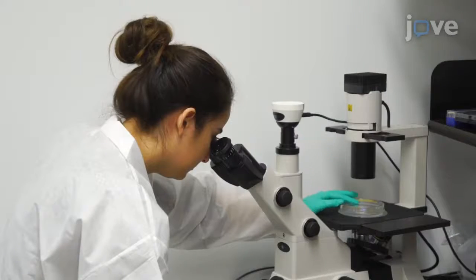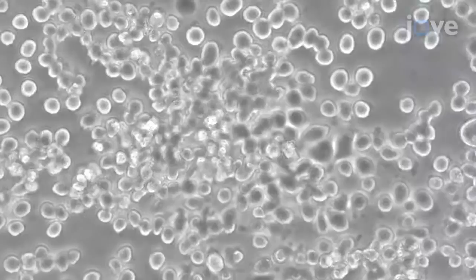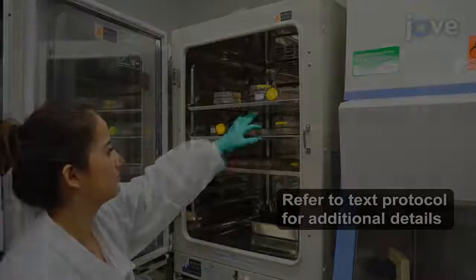Then, under an inverted microscope at 4 to 10x, check that the cells detach from the dish, become round, and float. Gently tap the side of the culture dish to dislodge the cells, and if necessary, re-incubate the dish for an additional 5 minutes.